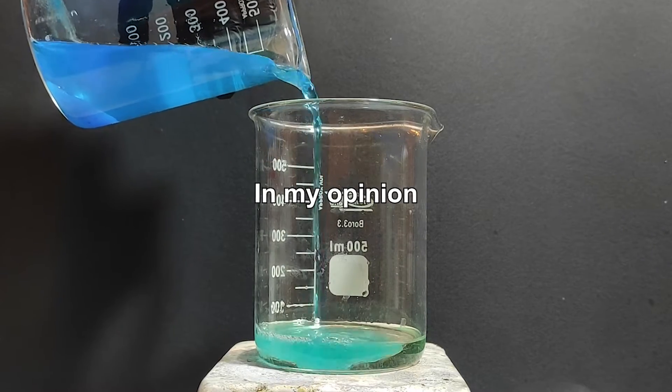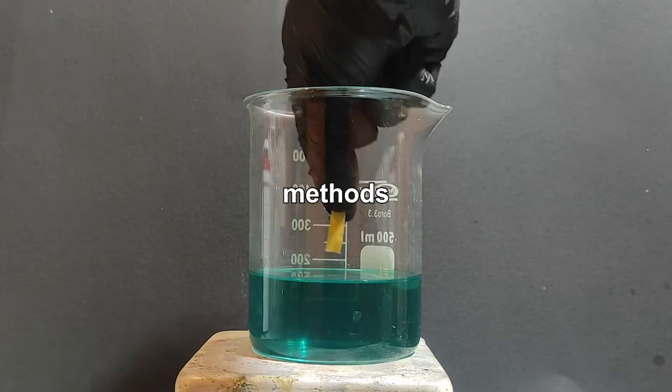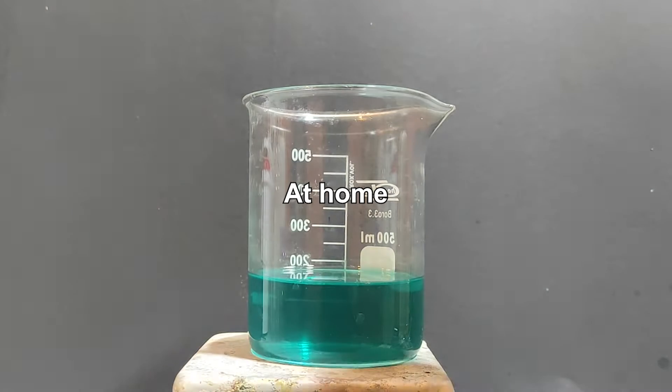This video I'll be showing in my opinion the easiest and one of the most available methods of making sulfuric acid at home.